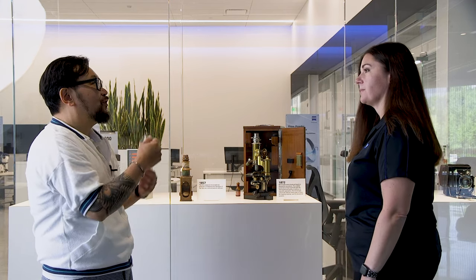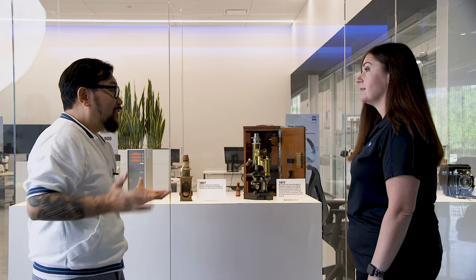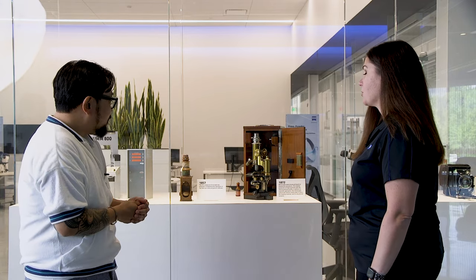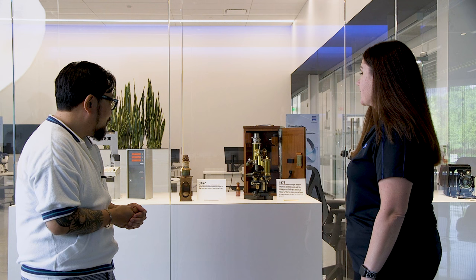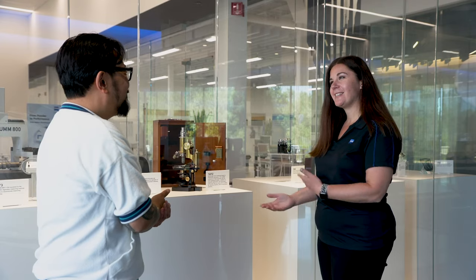So I'm hearing the tracking of the evolution of the camera side, but a lot of things have to evolve as we move forward. Correct — just getting better lighting and better cameras means we can see more even with the same lenses. So can we have a look at the different ways that this has evolved? Sure, let's come into the lab.